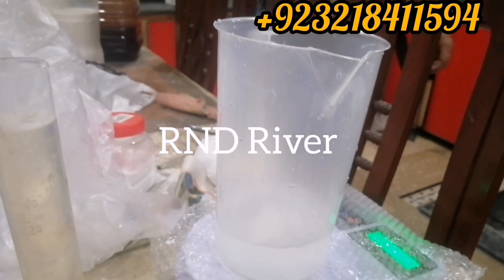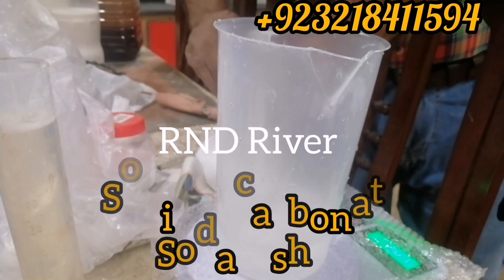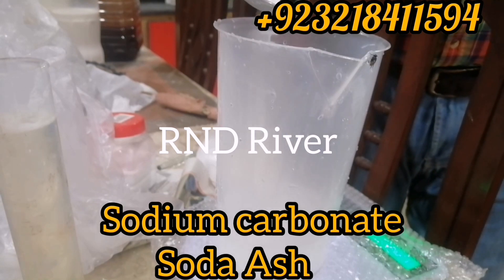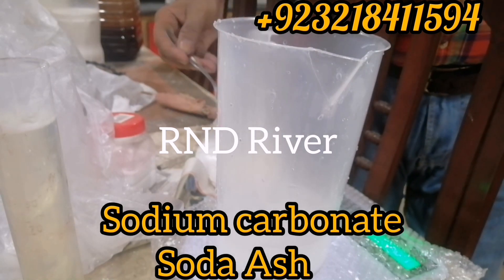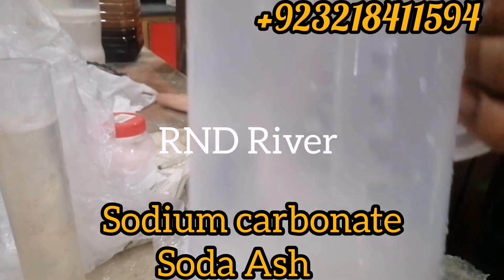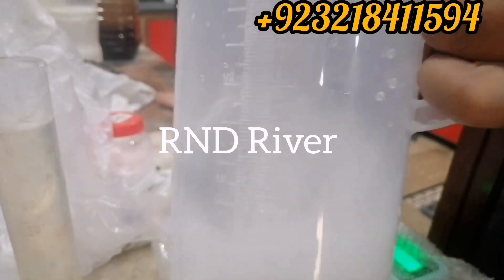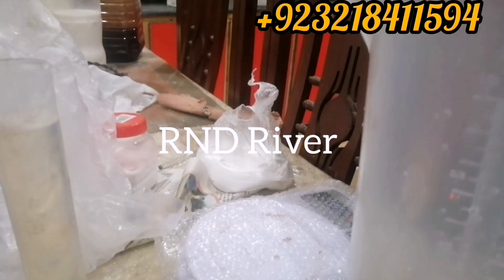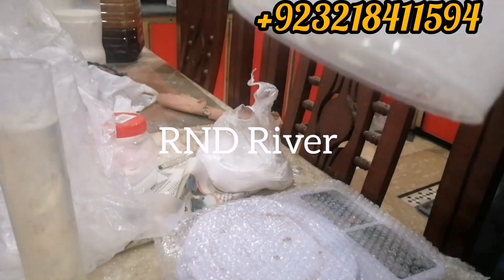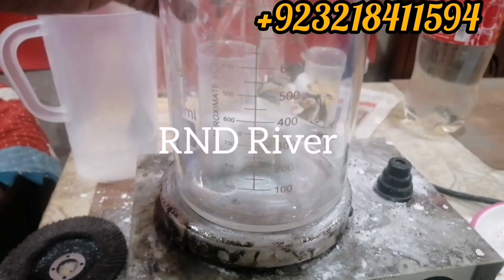In the meanwhile, as the temperature increases, we have to prepare the next item: sodium carbonate soda ash. Dissolve it well in water until the last particle has been dissolved.